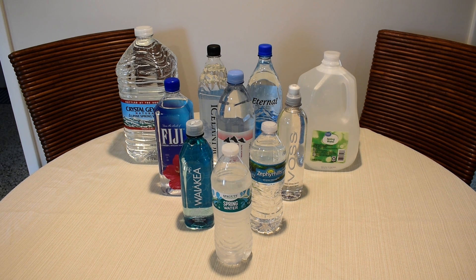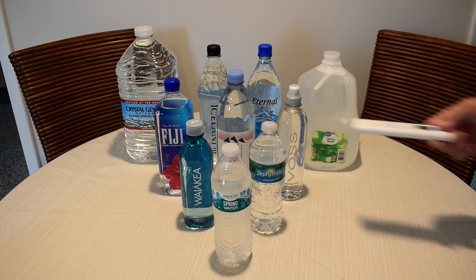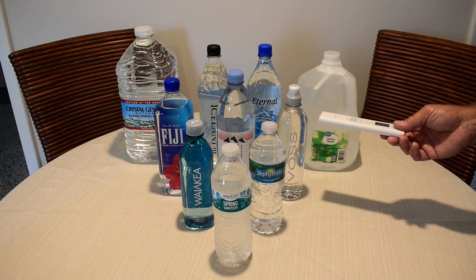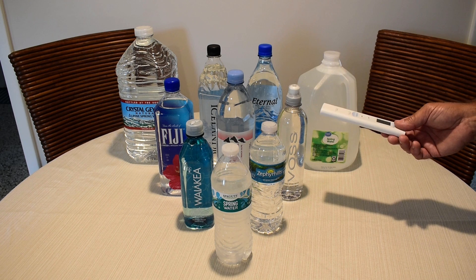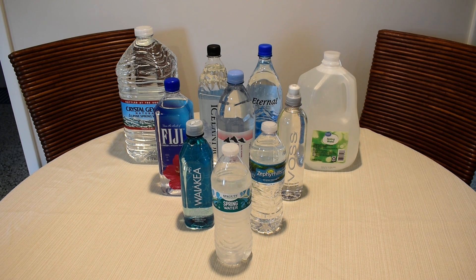The fourth test we'll be performing is for TDS, or total dissolved solids. Generally you want to see a lower value, 250 or lower. But keep in mind, just because there's dissolved solids in the water, it does not mean they are bad. It may be minerals or salt.